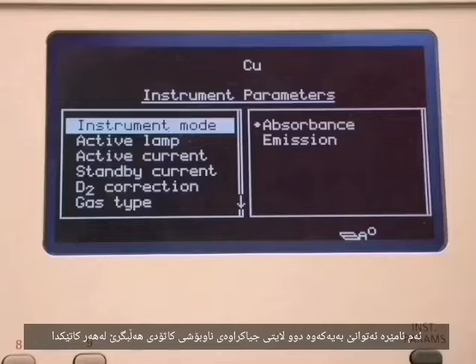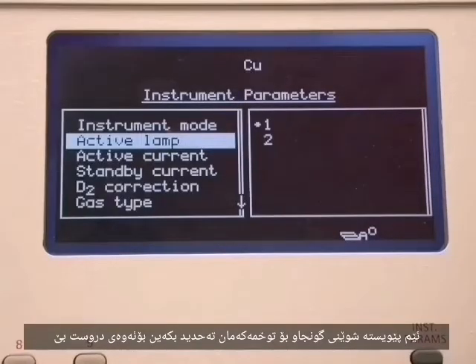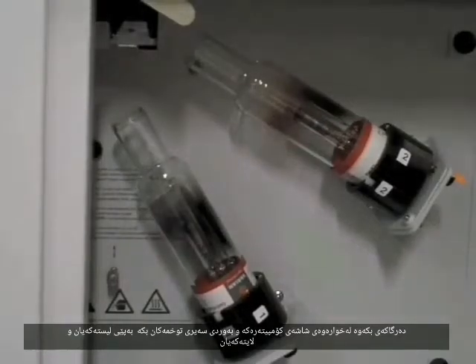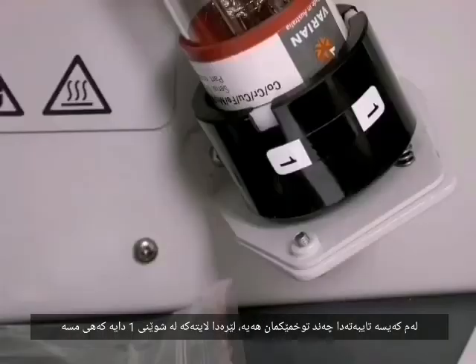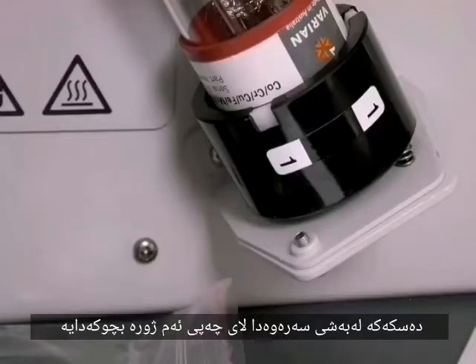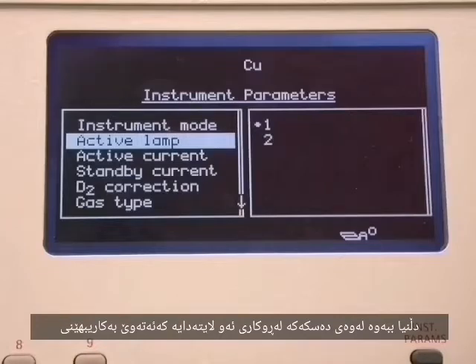This instrument can hold two separate hollow cathode lamps at any time. We need to determine which position the lamp for our element is located. Open the door below the computer screen and look closely at the elements listed on the base of the lamp. In this particular case, we have a multi-element lamp that includes copper in position 1. A lever at the top left of this compartment is used to select the active lamp by directing the appropriate light beam to the flame using a mirror. Be sure the lever points to the lamp that you want to use.